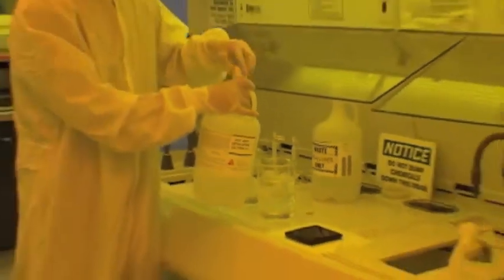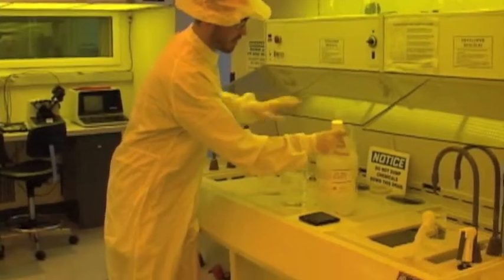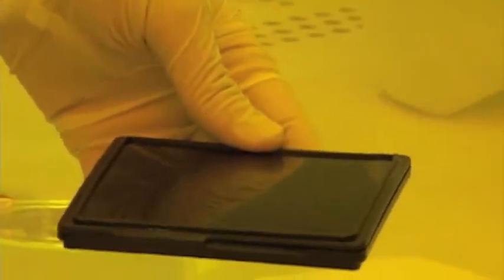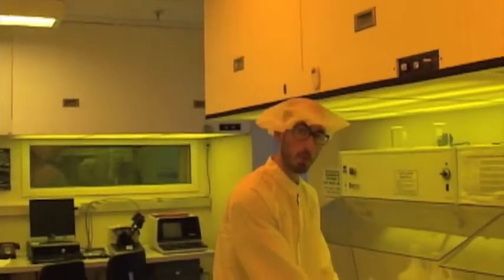And now we're going to take the mask out of this container. Now we transported it in this black plastic container to prevent the UV light from outside from degrading the photoresist. That's the reason that we have these funny yellow lights in this room, to prevent the mask from degrading when we don't want it to.